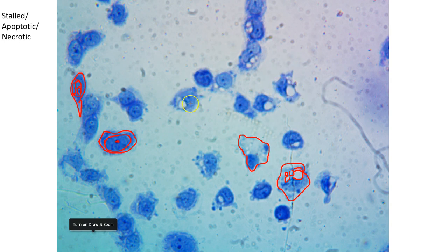So in the cytoplasmic space, you're seeing these big vacuoles, empty spaces, and then they're not empty, they're fluid filled, but they look like they're holes. And then pixelation in the membrane indicates permeability is getting lost. Membrane permeability is compromised, which indicates that these are necrotic cells. So that would be an example of those.